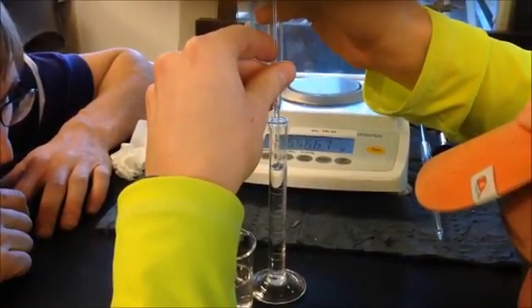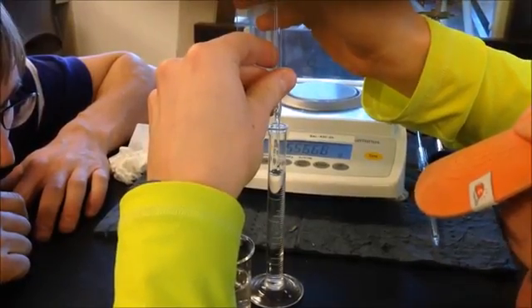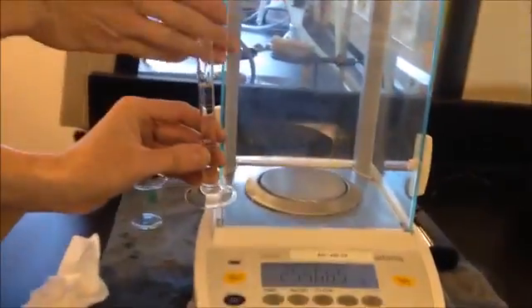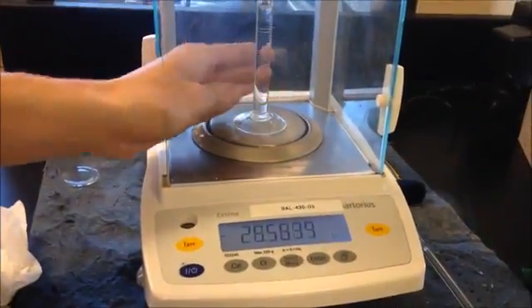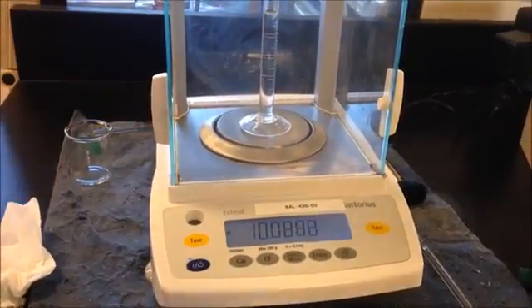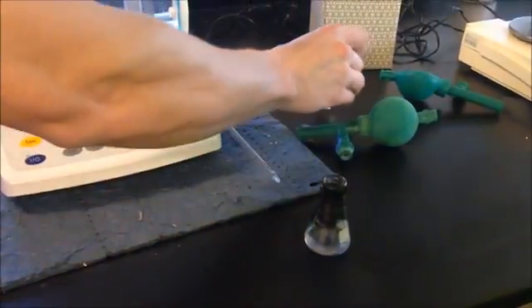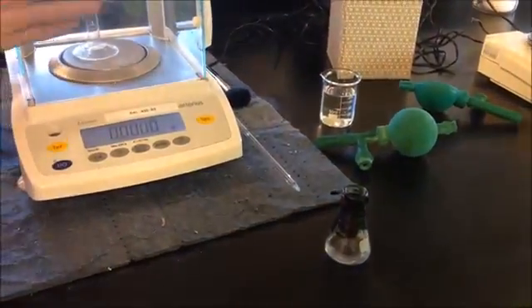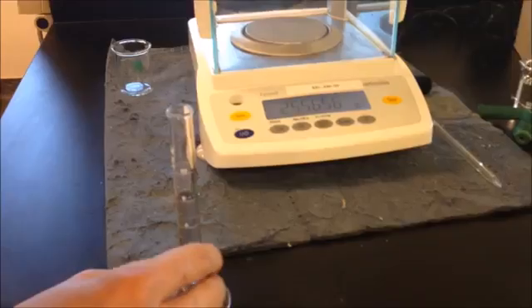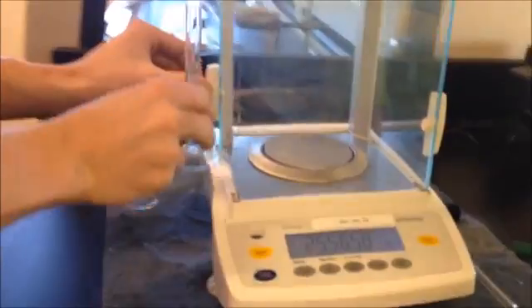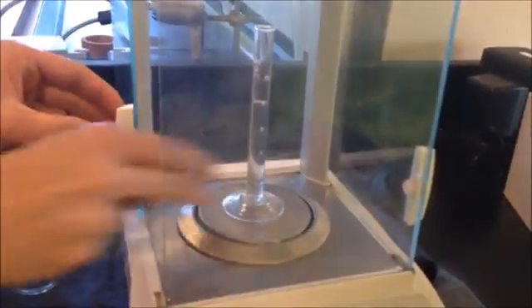Is it the bottom of the meniscus that we put it? Yeah, right from the bottom of the meniscus. There you go, that should do it. Should be pretty dang close. Let's see how we did. 10.086. Okay, so I got this opened up for you and we're gonna try to bring this over. Excellent. So we got exactly eight milliliters in here and this is tared to the weight of the flask. Let's see what it weighs.